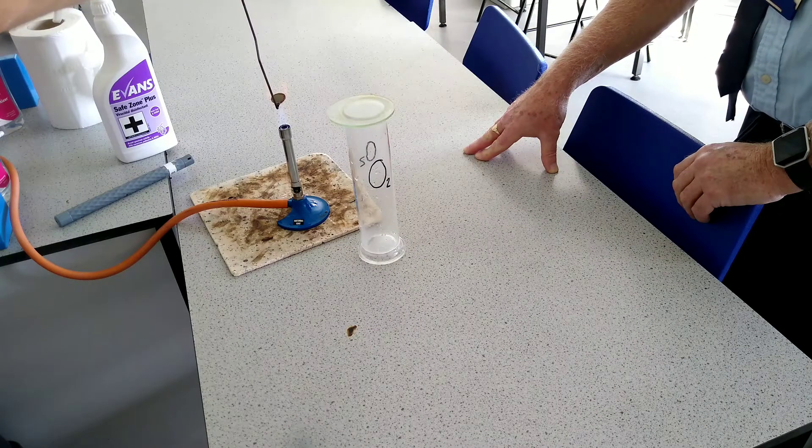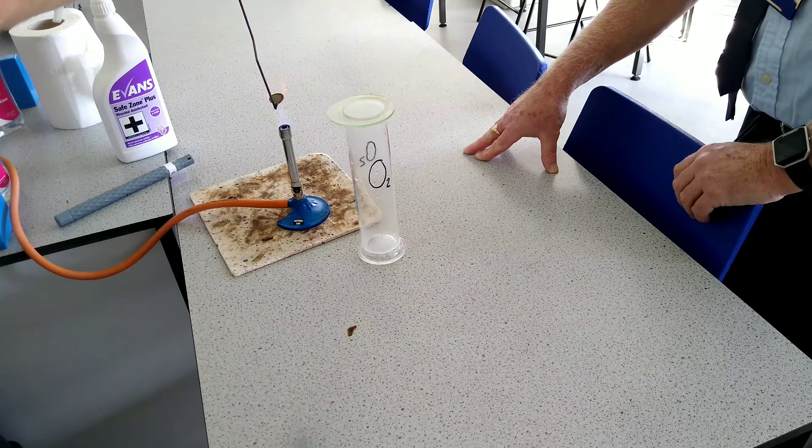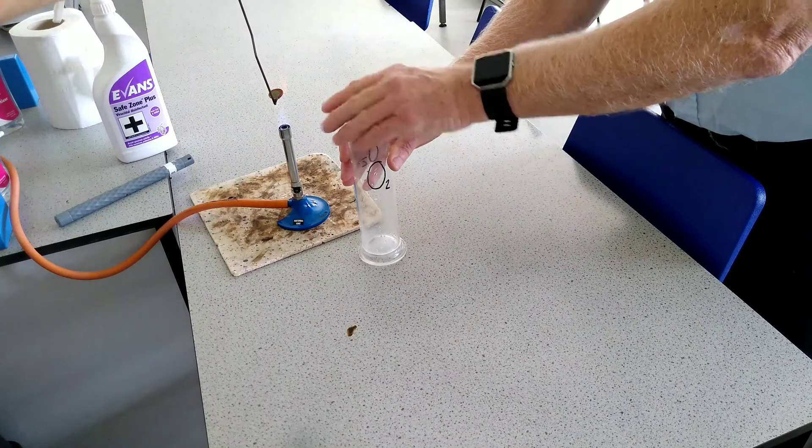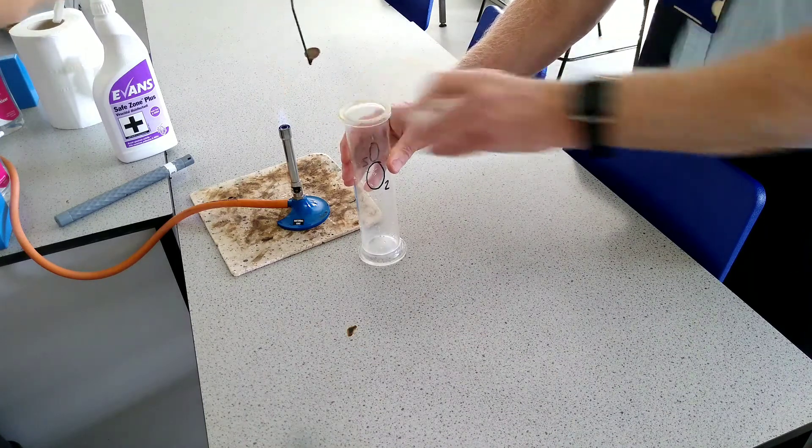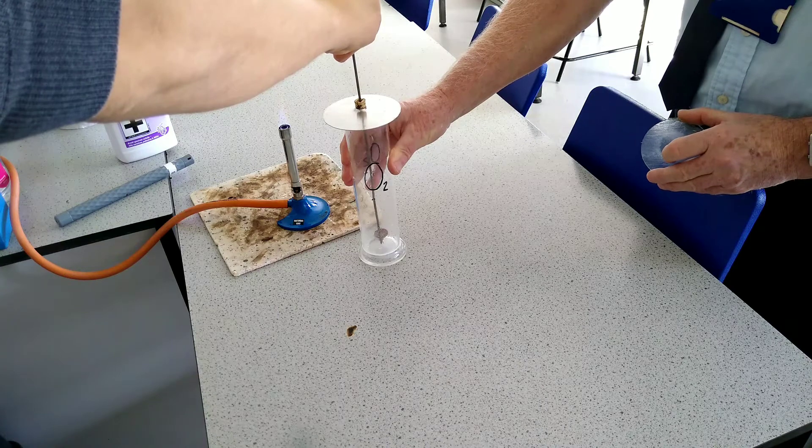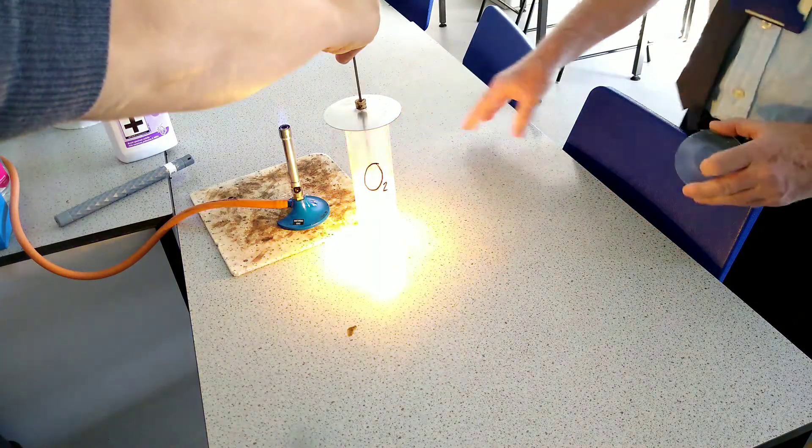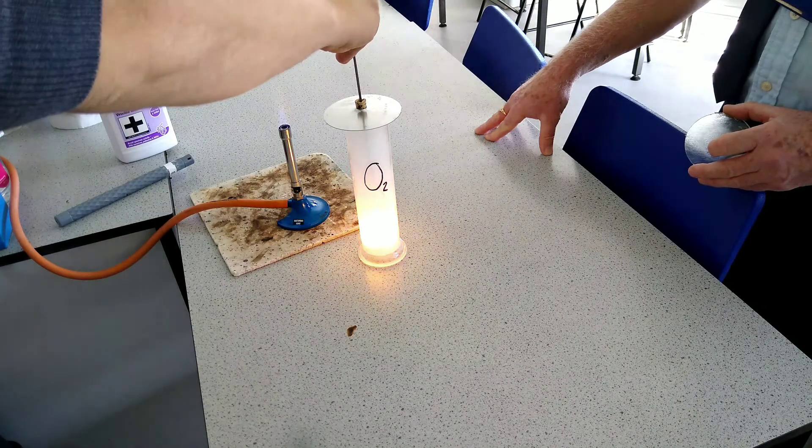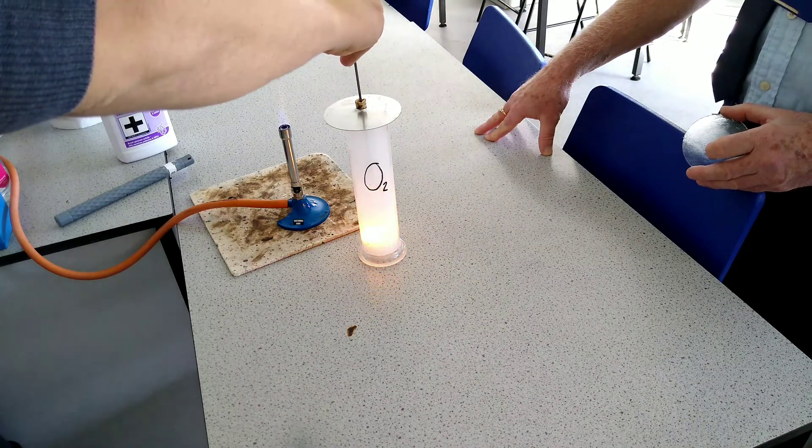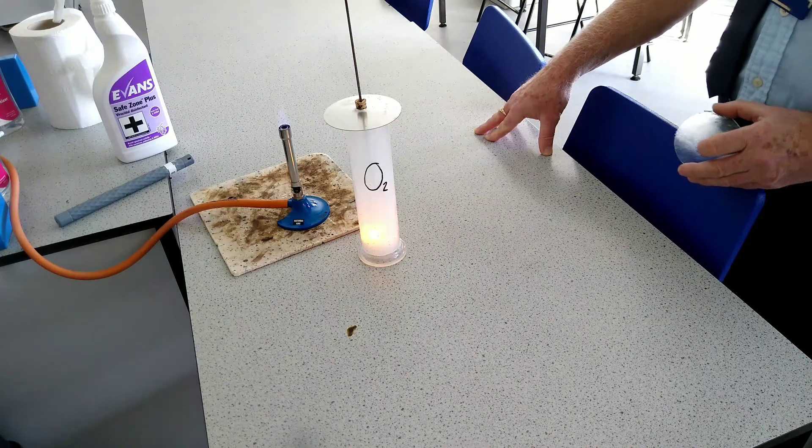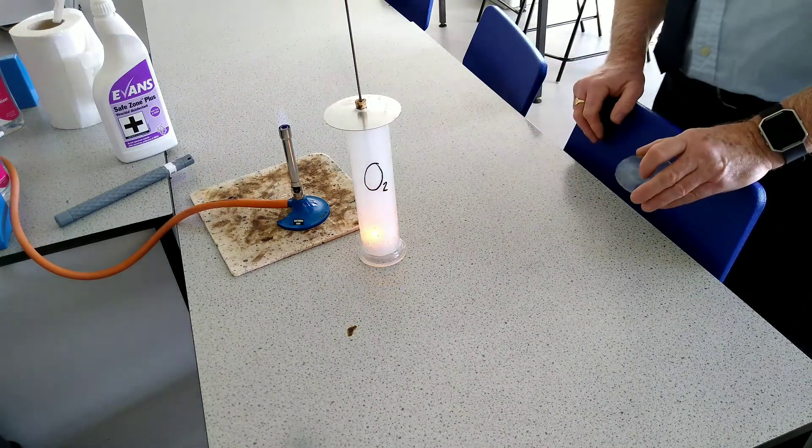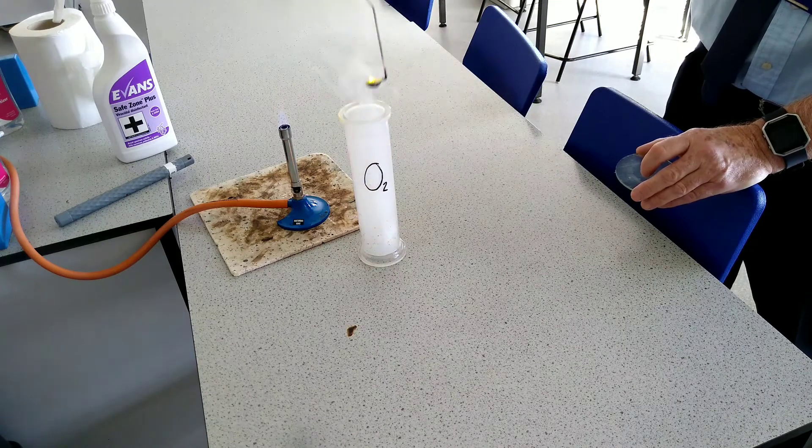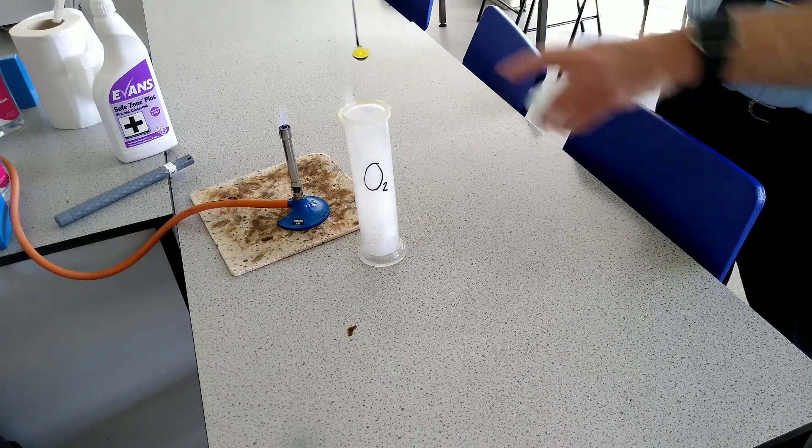So I've had to re-record the zinc and zinc plus oxygen. So we're going to make some zinc oxide here. The previous recording didn't work well because the zinc completely oxidized before I managed to get it into the oxygen. You see that nice bright color there showing you that zinc oxide is being made. Now I'm going to remove the deflagrating spoon from the reaction. This is zinc oxide. It's bright yellow when it's hot and when it cools down it will go white.